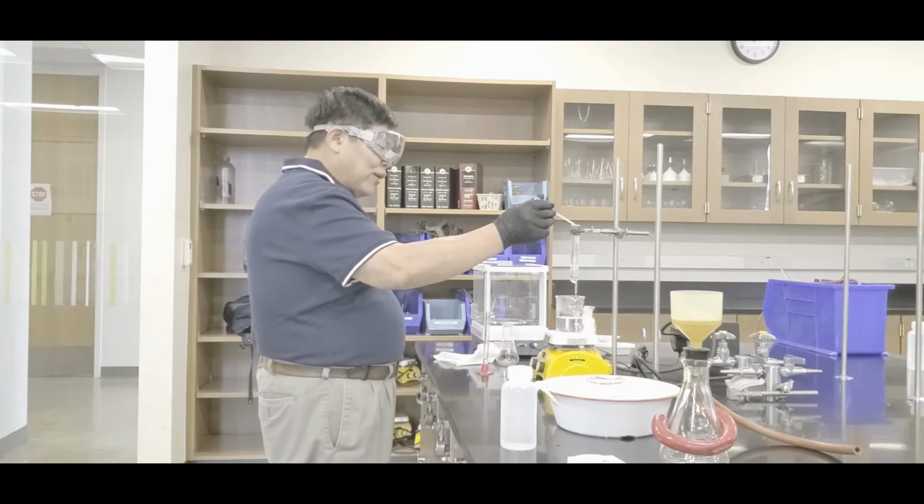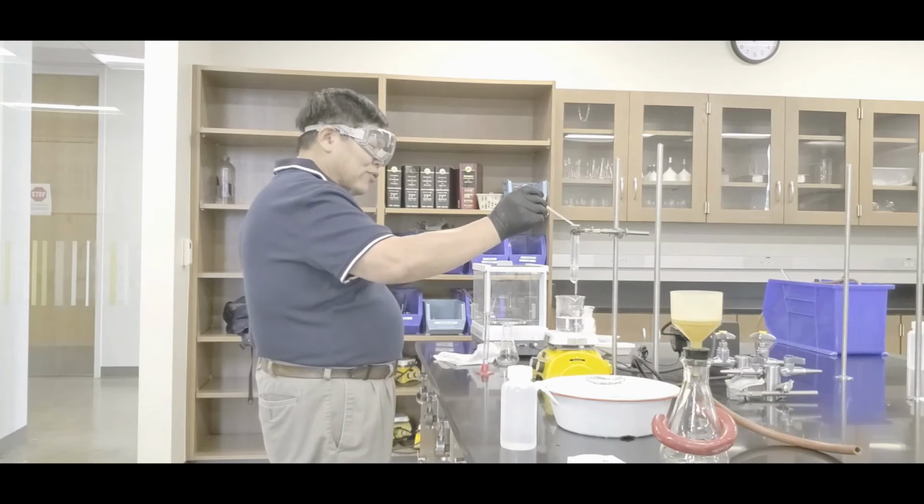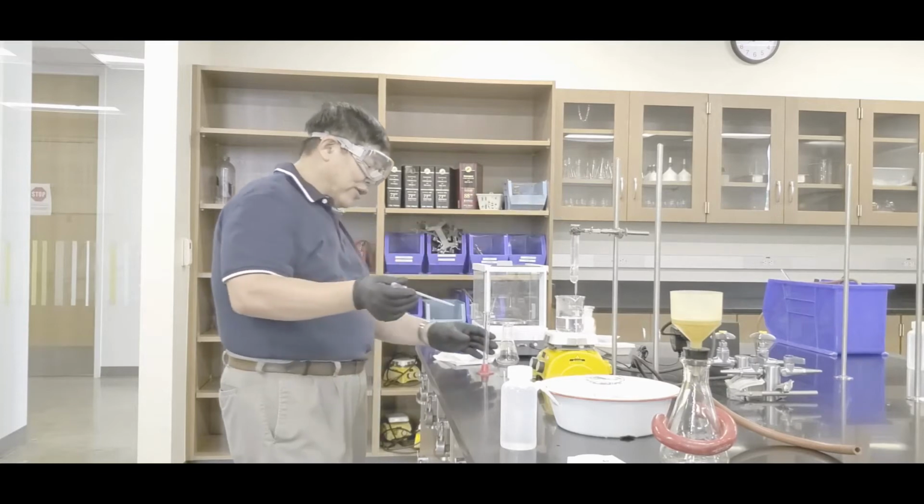And then you watch for it, in the sense that you do not want this thing to be boiling. Oh, it's fizzing right there, okay? So I'm going to wait a little bit more. Drop, drop. Now that it's settled, you can slowly add more, yes? And you notice that I'm keeping it about arm's length away from this thing. This is not your friend, okay? In fact, this is the part of the lab that kind of wakes me up at night about you guys.